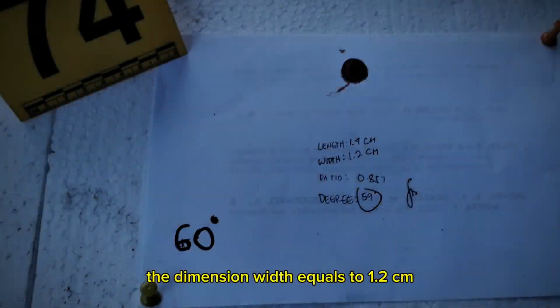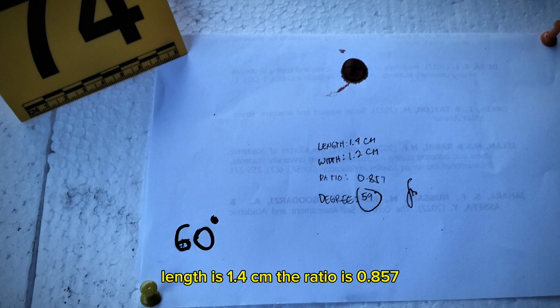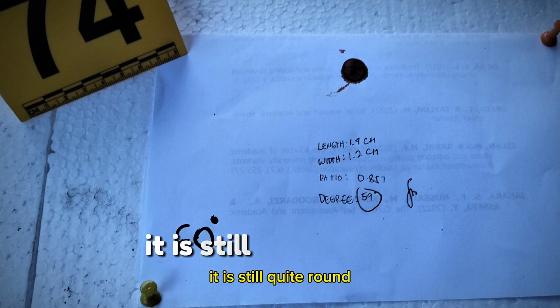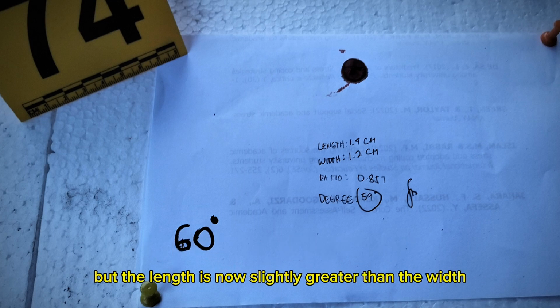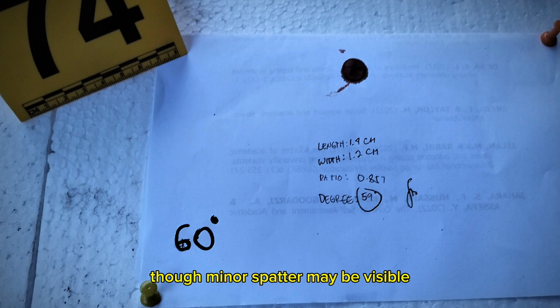The dimensions: width is 1.2 cm, length is 1.4 cm. The ratio is 0.857. Calculated angle: approximately 59 degrees, very close to the intended 60 degrees. Characteristics: it is still quite round, but the length is now slightly greater than the width. The edges remain smooth, mostly intact, though minor spatter may be visible.